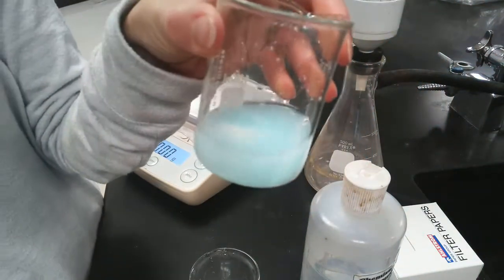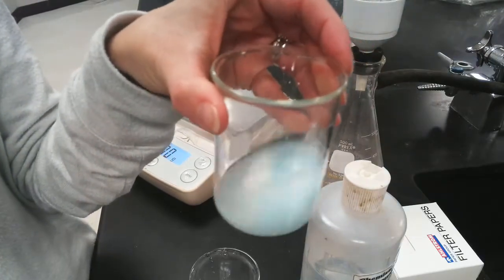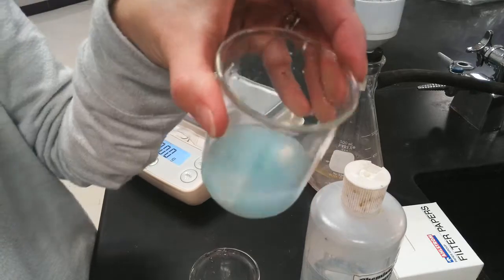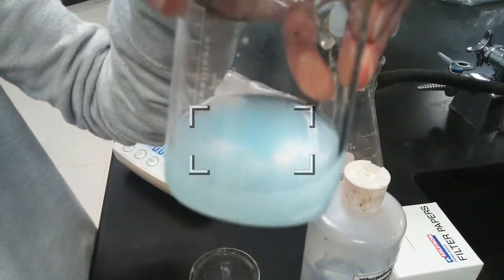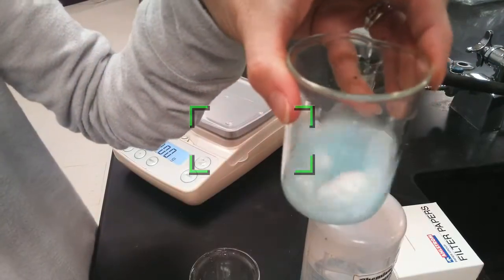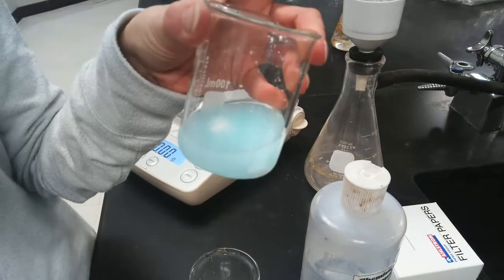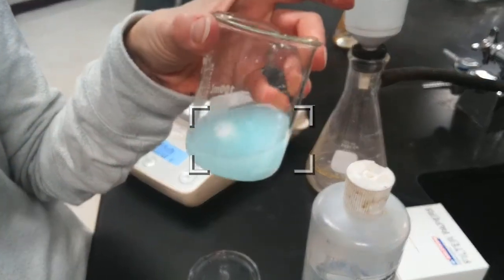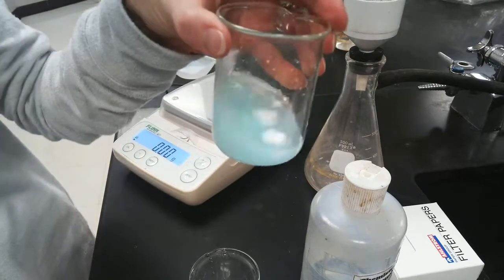And now all we have to do is filter. Now, I bet last year you filtered quite a bit when you were doing stoichiometry, or hopefully you did. Ooh, look at how nice that's chunking. There are some really nice white chunks in there. Filtering is like a test of your patience, where you take your filter paper and you have a funnel and a flask and you let it drip, drip, drip. Well, boy, do I have a treat for you.